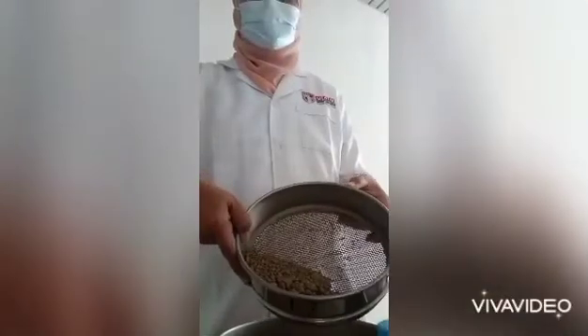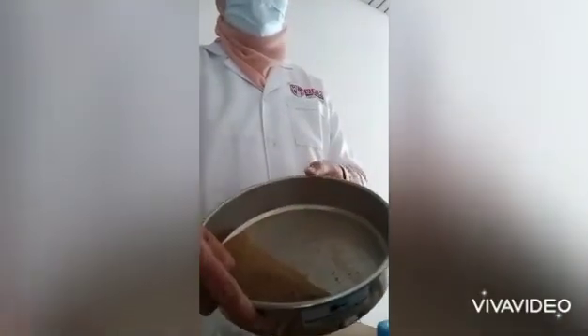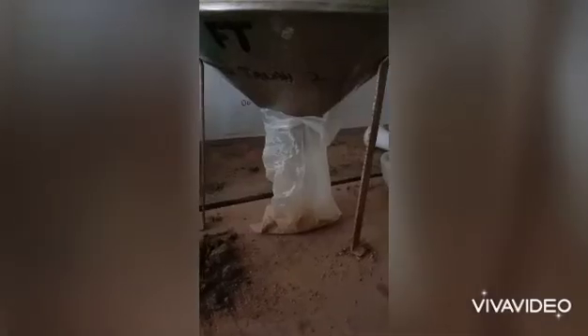The results: this is the unsieved one, and this is the sieved one that has a size of two millimeters and below. Then collect the sieved soil in a plastic bag, and this soil is ready for future analysis for pH, EC, and so on.